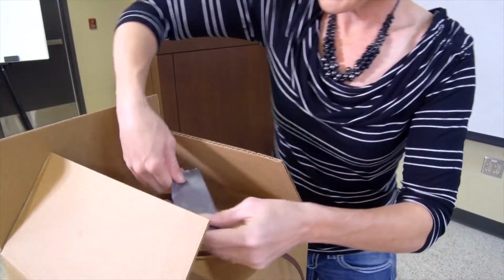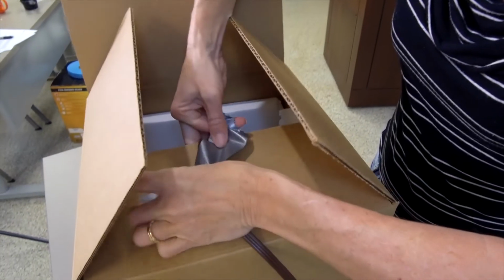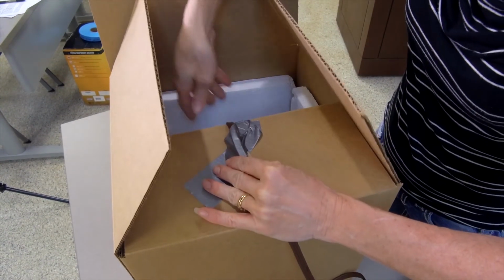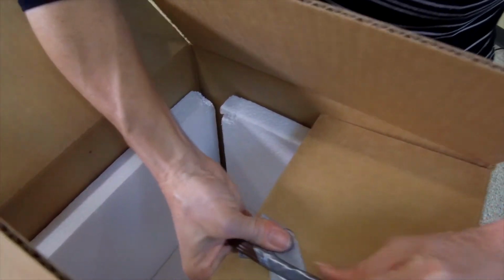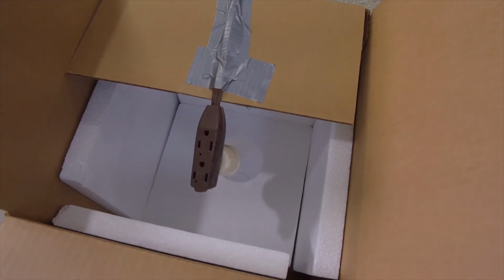So I just want to tape my light bulb in place so I don't have to worry about any fire hazards. So you want to suspend your light bulb essentially in the middle of your box so that it's not touching the edges. So then you just turn your box on and let it come to temp.